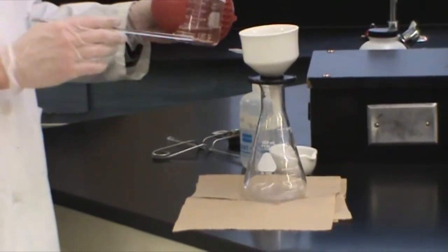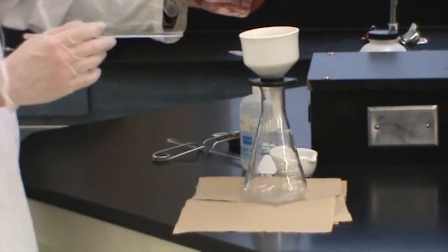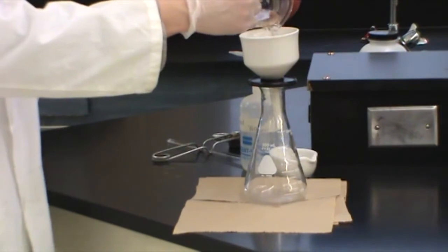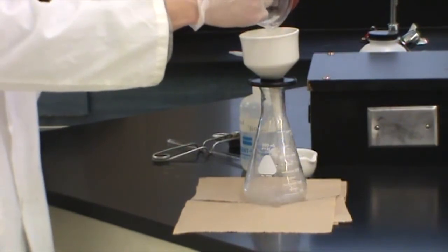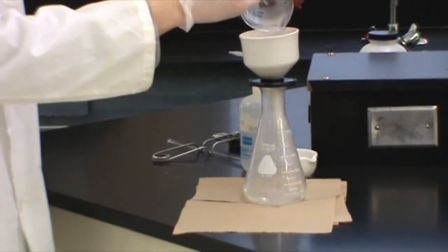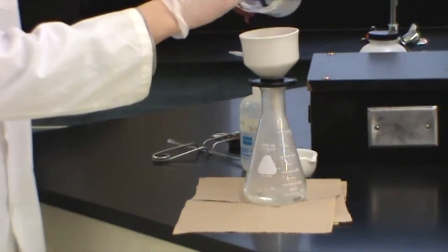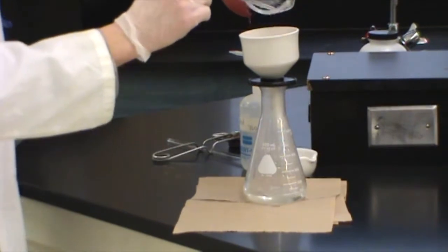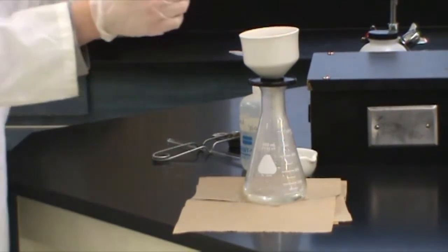Now we're going to wash the pennies and take them out of this vinegar solution and just rinse them with some cold distilled water. This will make sure that all the salt is dissolved and the pennies are clear from any impurities.